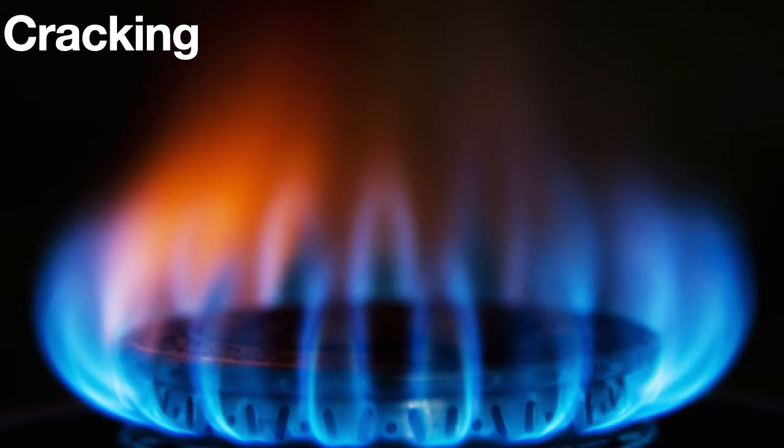And welcome to another video in this series introducing hydrocarbon chemistry. Today we're going to be looking at cracking. Now, cracking is an important industrial process, but for this video we are simply going to be looking at the chemistry of it and how you would do it in the laboratory.